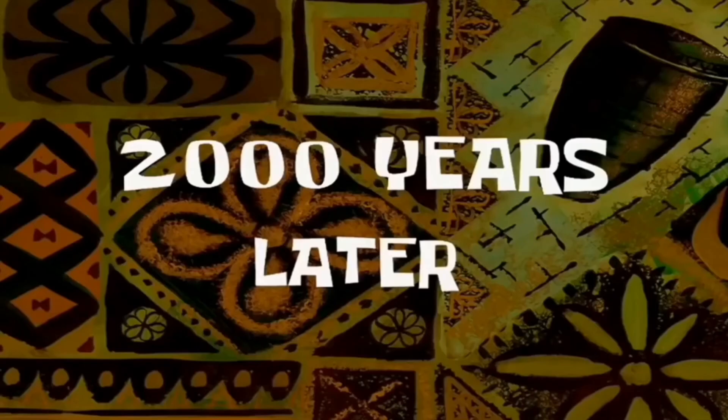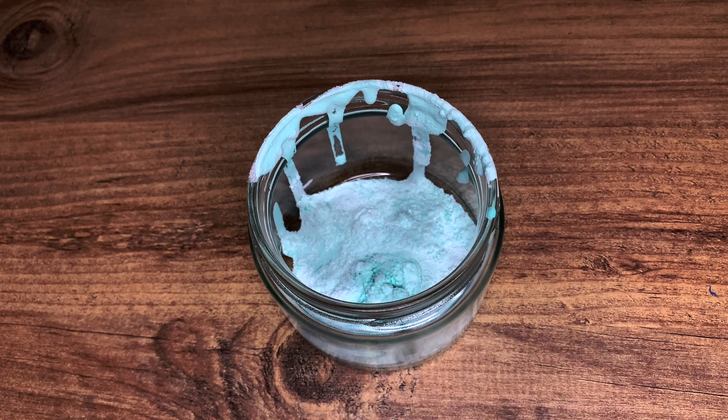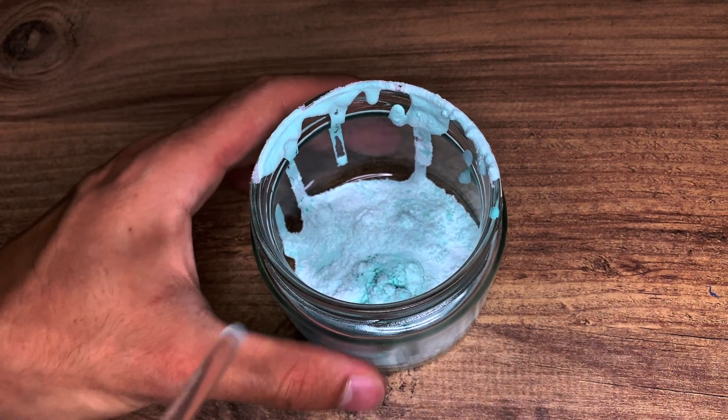Actually, I waited around one week. Finally, I get copper carbonate salt.